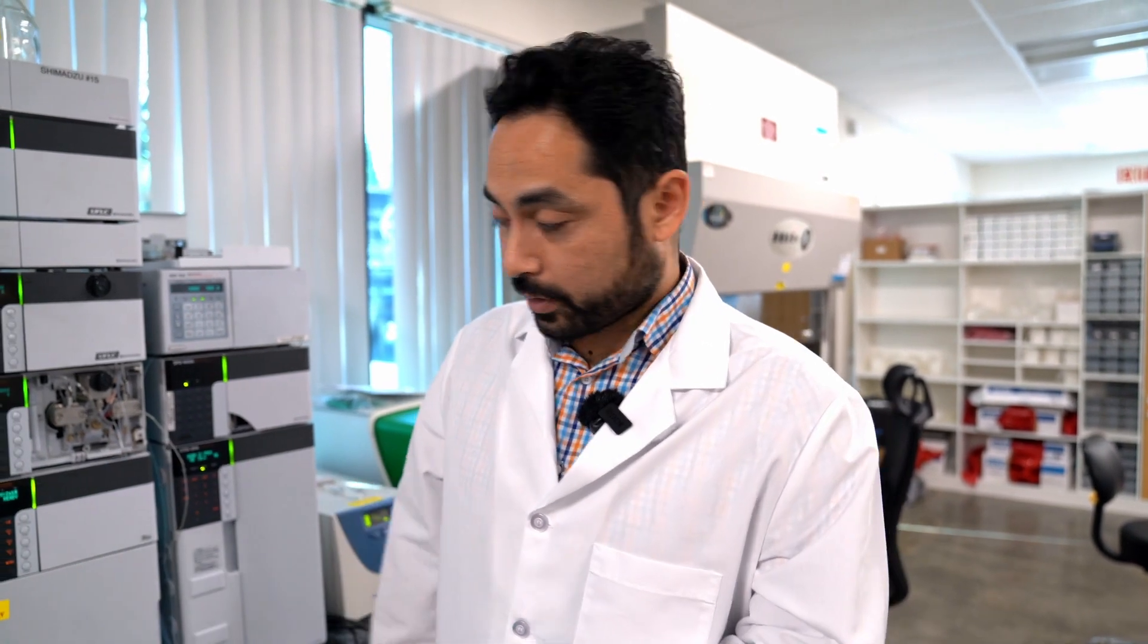There's a manual purge which you do from the front panel on the system and there's a way to do it in the software. Let's go over the manual way first.